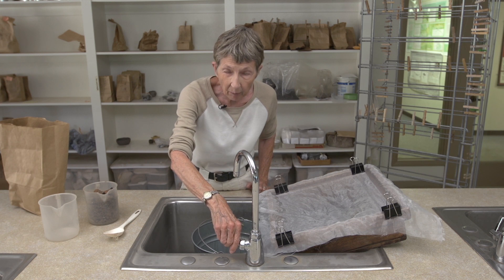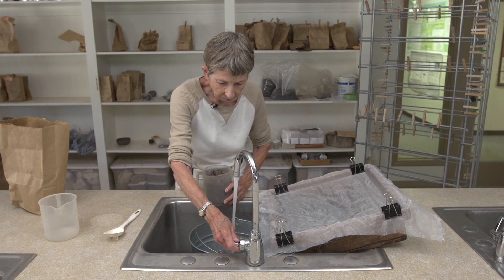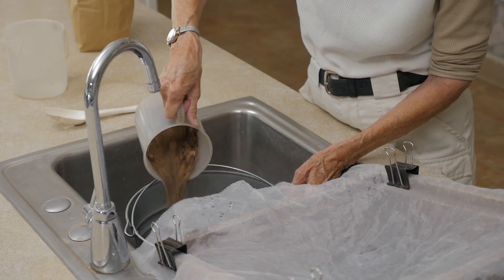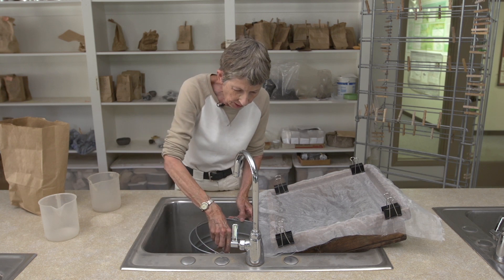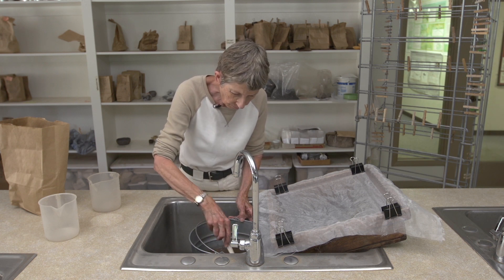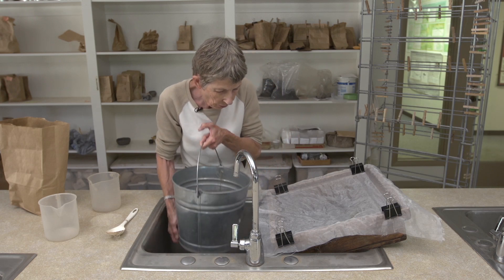We then fill up this bucket with water. I've got my sample right here and I'm going to pour it in. I can already see that some charred, burned plant bits are floating on the surface. I'll stir it a little bit to help break up the dirt clumps. And now I'm going to pour it through this wedding veil, which is suspended over a piece of window screen.